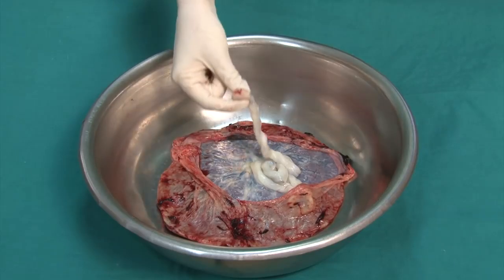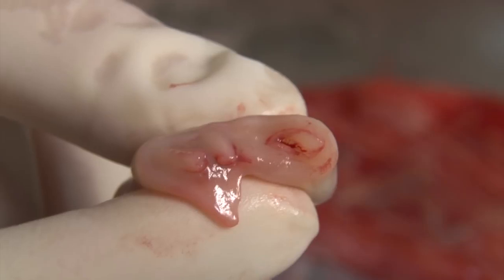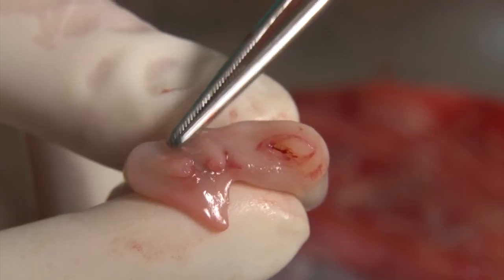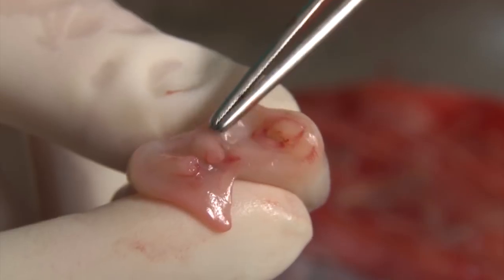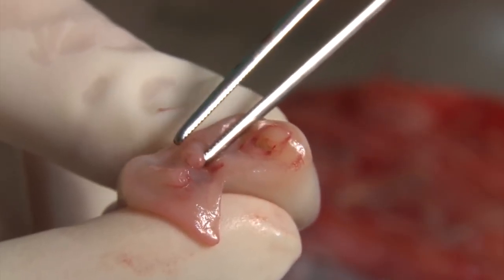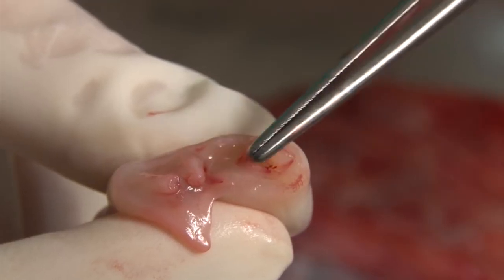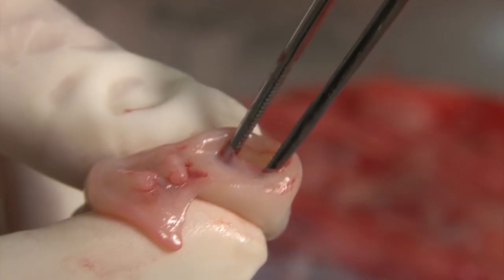The umbilical cord, which connects a baby to the placenta, has 3 vessels. The number of vessels are best counted on a clear-cut area of the cord. Here are the 2 arteries through which the blood of the fetus is moved to the placenta. There may be only 1 artery present, which is not lethal to the fetus, but it should be recorded in the notes. The umbilical vein transports the blood from the placenta to the fetus and is essential to fetal survival.